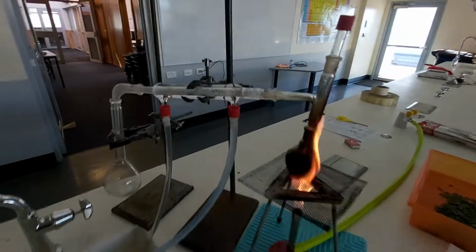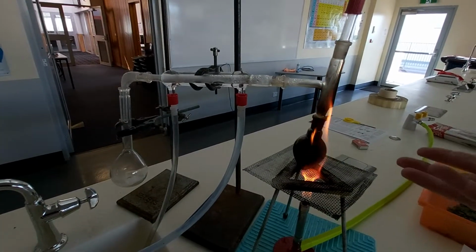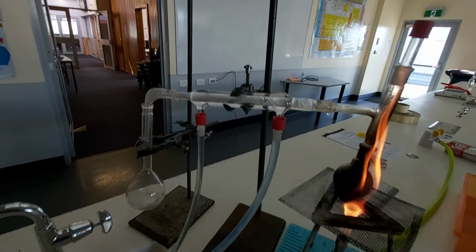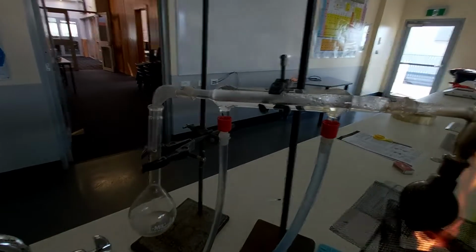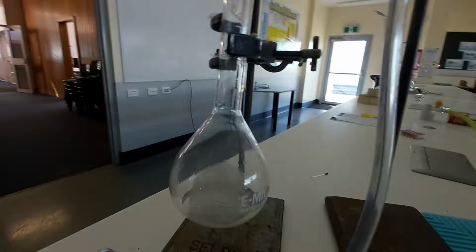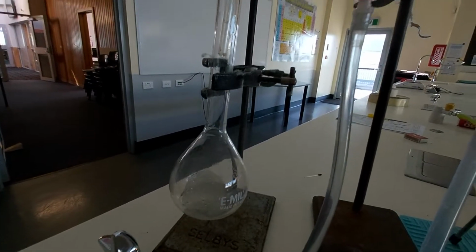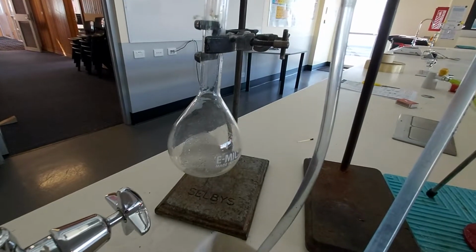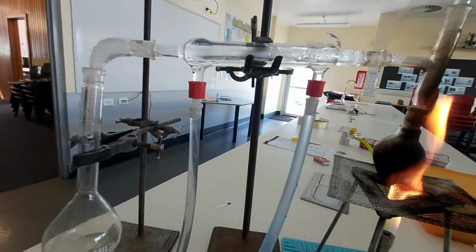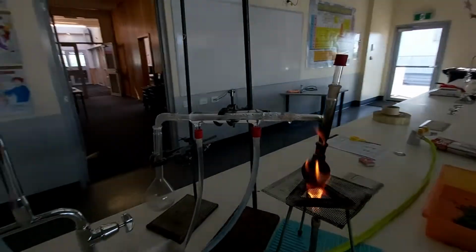It's exactly the opposite of evaporation. So evaporation is using heat to turn a liquid into a gas, and then along here we cool that gas down and it turns back into a liquid. So hopefully here in our little jar we should be collecting our eucalyptus oil, probably with a little bit of water, okay, at the end. And I have to keep that water running through there to keep this part cold. All right.